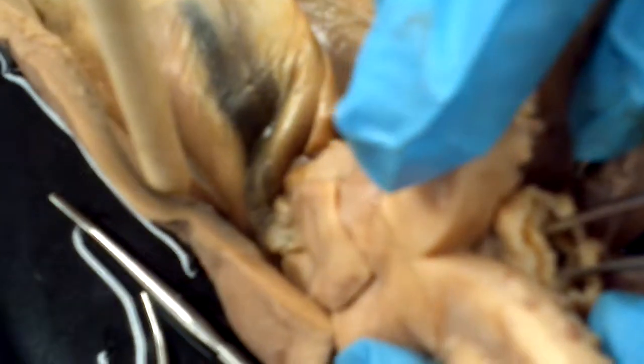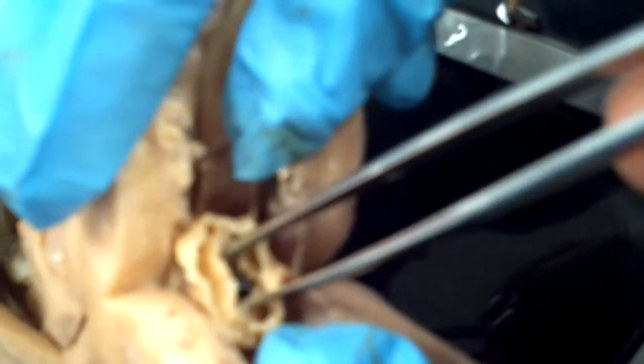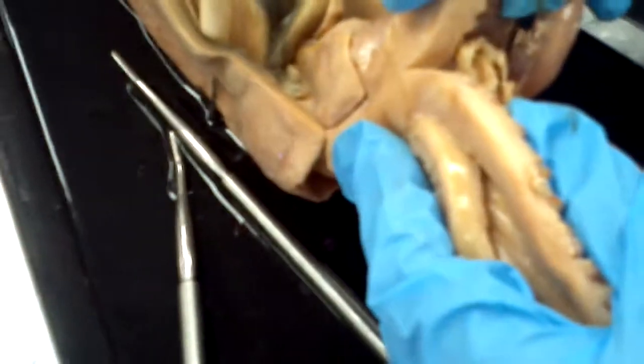We need to identify it — it's right there. There's the jaw. That's the jaw, because the tooth is in there. It's a black object. Is it a beak? It's a beak — there's two parts, like a top and a bottom.